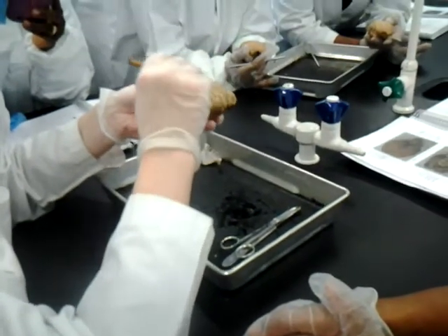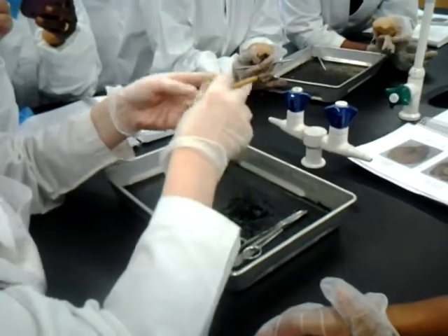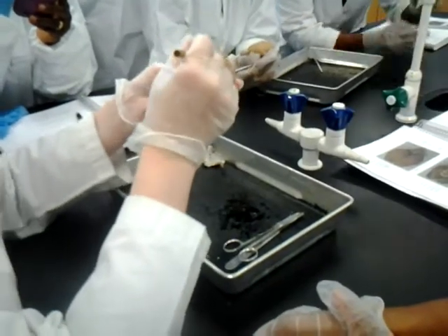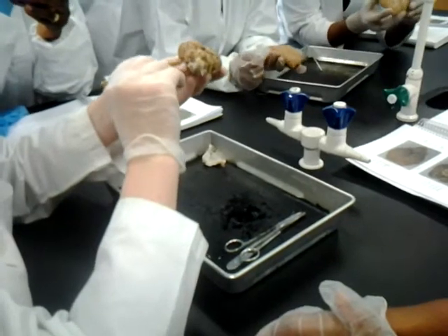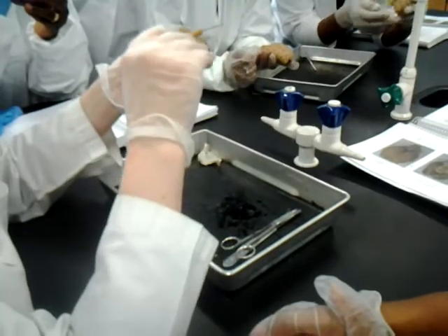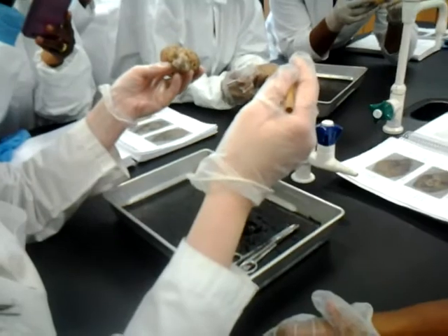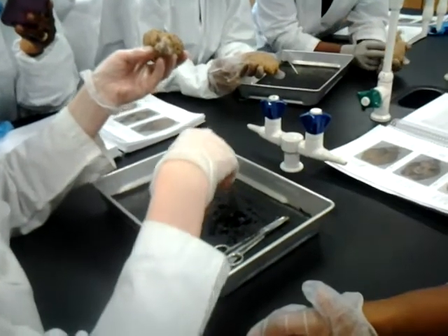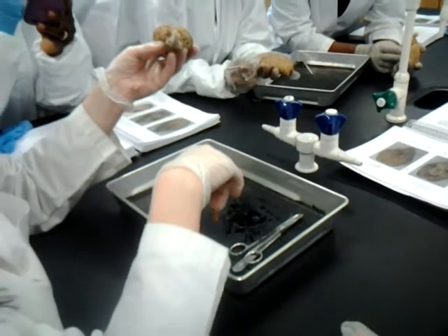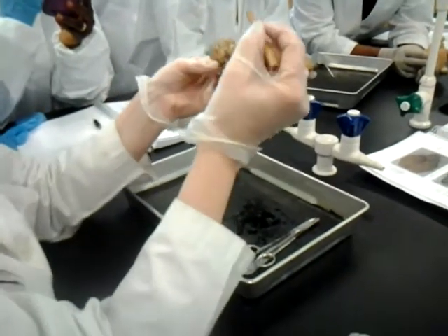Let's see. This, of course, is the longitudinal fissure. The question might ask what structure is this, or maybe what divot is this, or line. On the cerebellum, remember the basic function of the cerebellum is balance and coordination. You either can write the function as the lab manual writes it, which is a little bit longer, or if you want to use the shortened version, it's balance and coordination. If you just say balance, I will take half off. So if you're going to use that shortcut, I want both words, just a heads up.